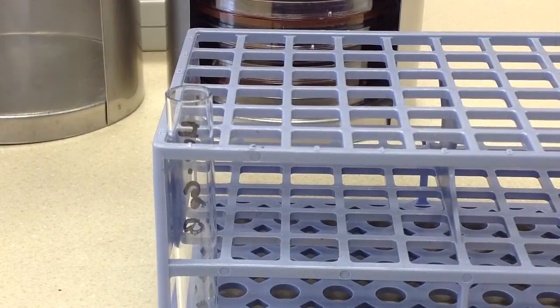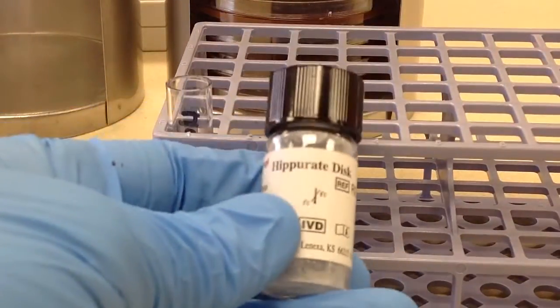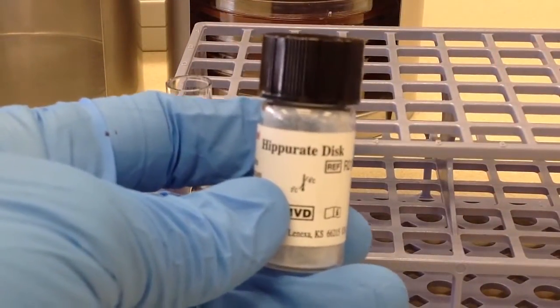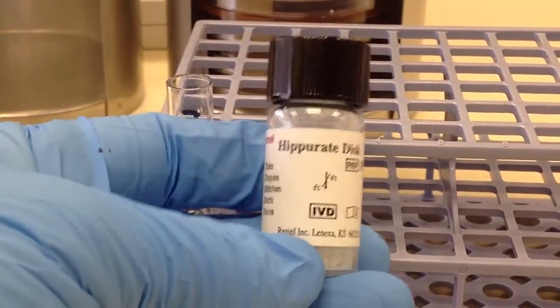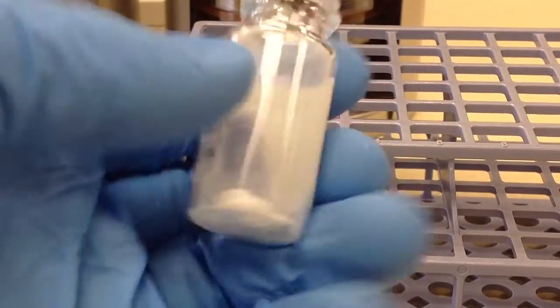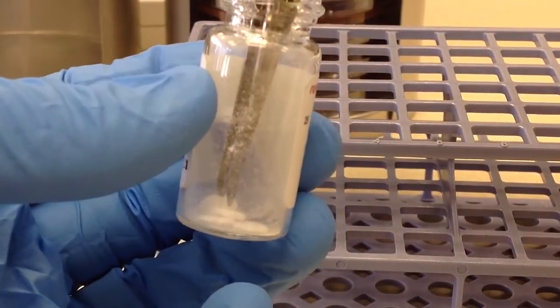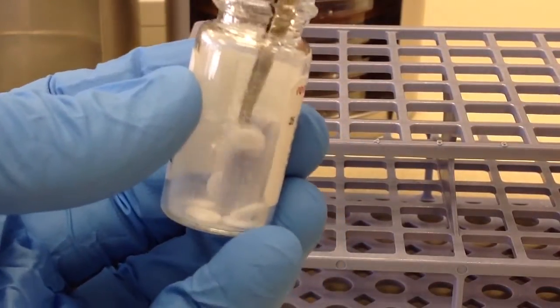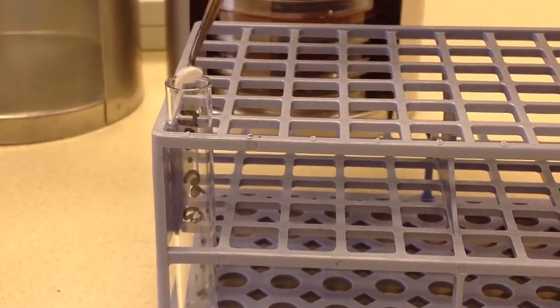Our next step is to take one of the Hippurate discs. A little bit tough to get out of there, but I'll go ahead and drop that in there.